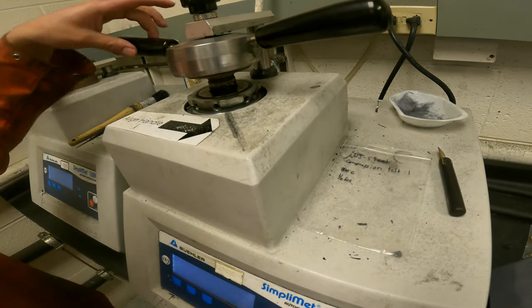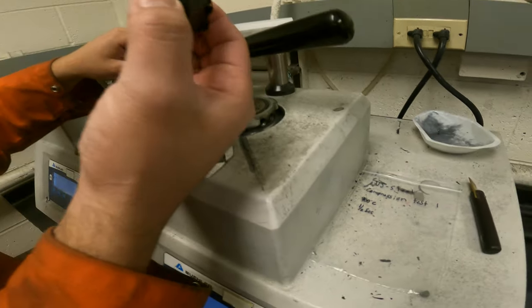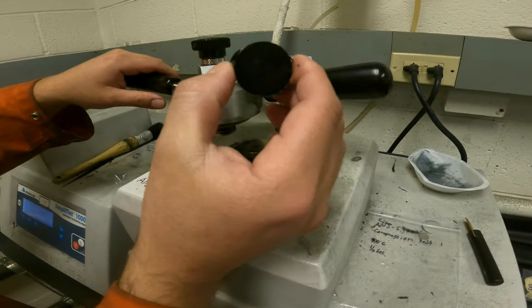Don't start to push it with this closed. You can see the sample is coming there. You have your sample in the puck now.